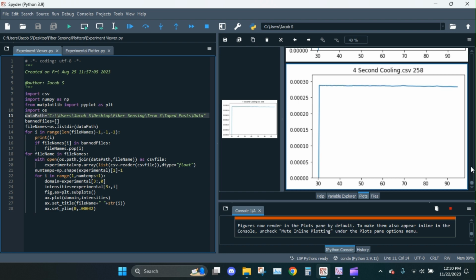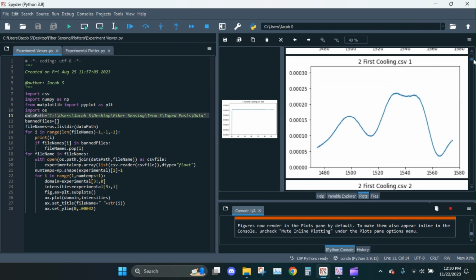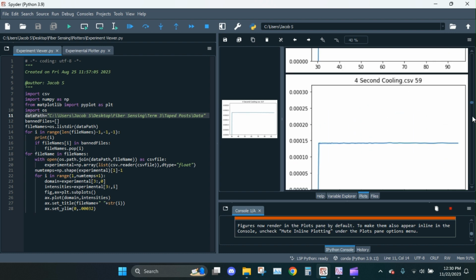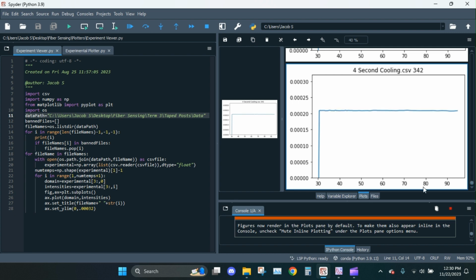Alright. And look at us going back there. No wonder it took a while. Like I said, I'm doing this live. Anyway, something's clearly wrong. I'm just going to halt it.